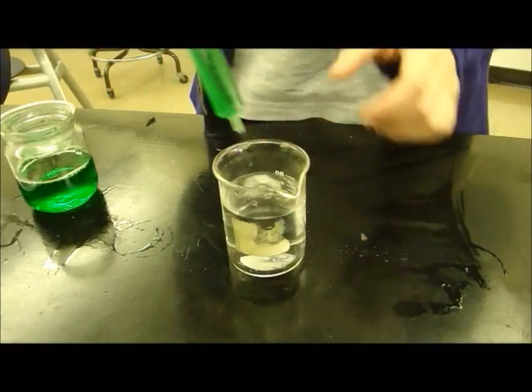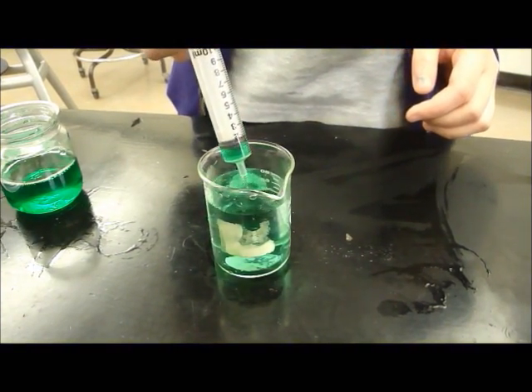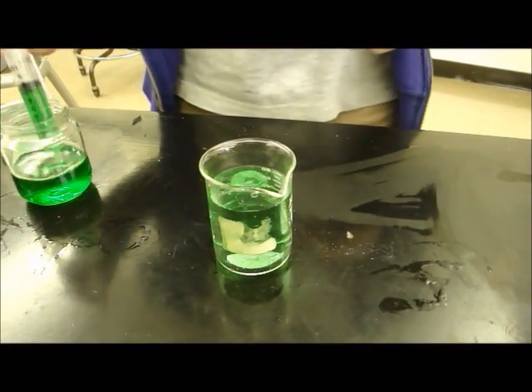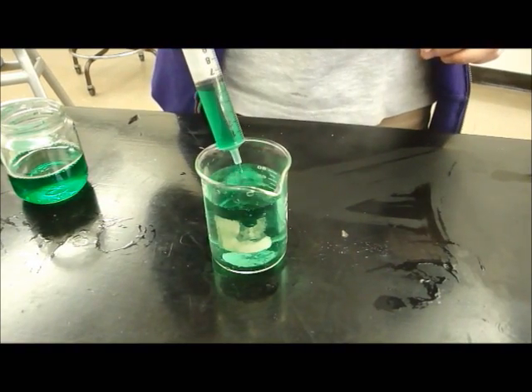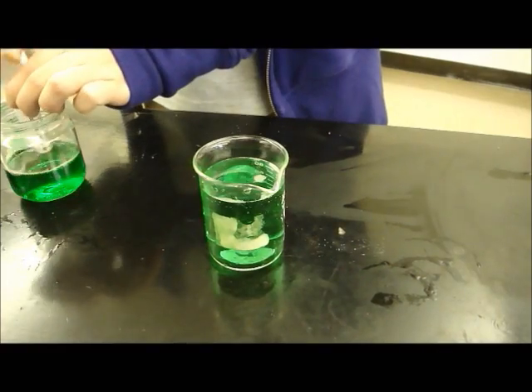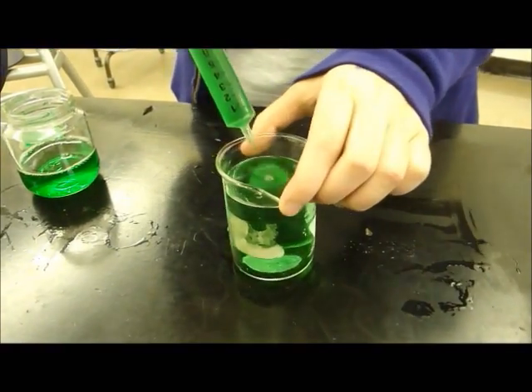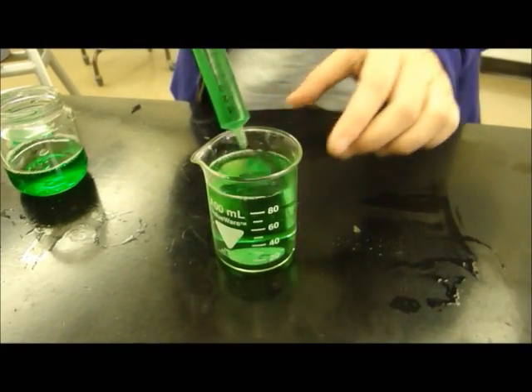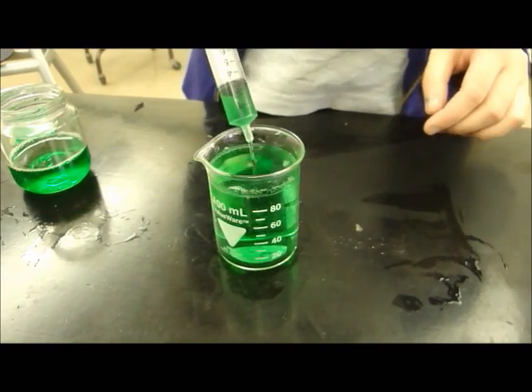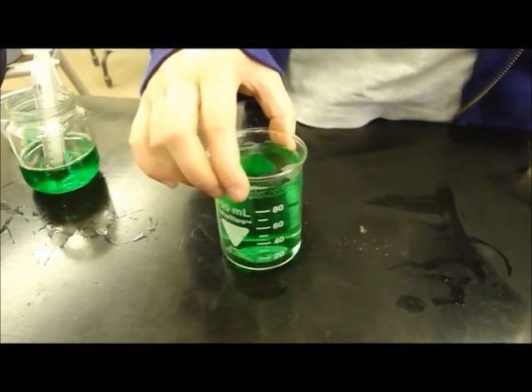For this part, mouthwash will be poured into beakers that contain water and soap. Mouthwash is a chemotherapeutic agent used to enhance oral hygiene. Certain mouthwashes use fluoride to protect against cavities or tooth decay. Fluoride is a chemical ion of the element fluorine, in that fluoride has one extra electron that gives it a negative charge. In this experiment, this is fluoride mouthwash. As you can see, the particles in both the mouthwash and water mix very easily. This is similar to what happened to the dissolution of the salt in the water earlier.